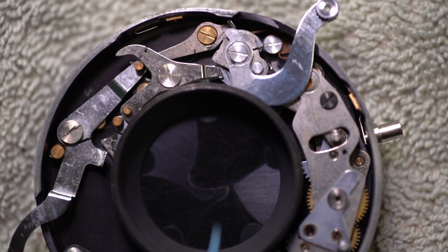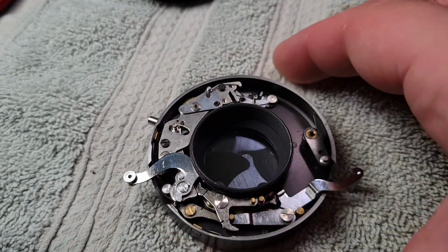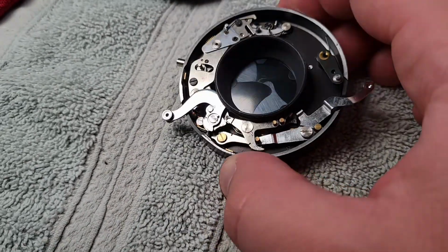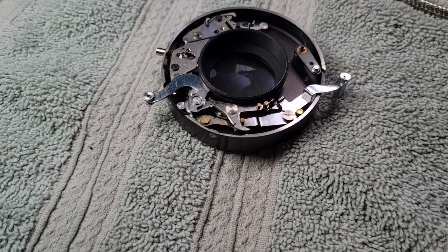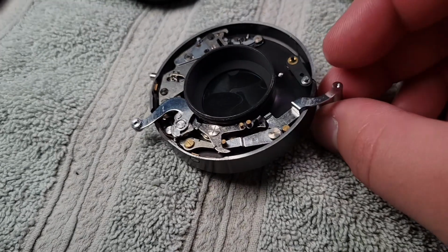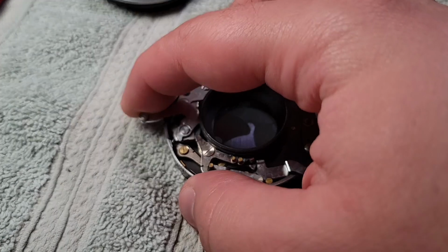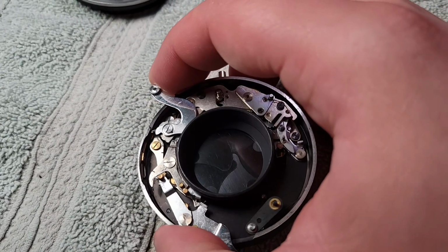The good thing about this is it locks open like that, so you can actually use it with a digital camera, and the digital camera, especially if it's mirrorless, doesn't have a shutter. And so you just activate that however you do, and there's no vibration. You don't even have a remote shutter. This is a different view of what you just saw with my macro lens. Undoubtedly lesser quality video, but possibly a little bit easier to see.